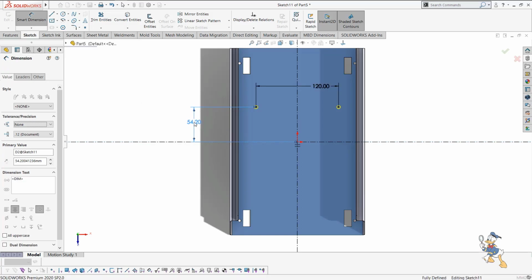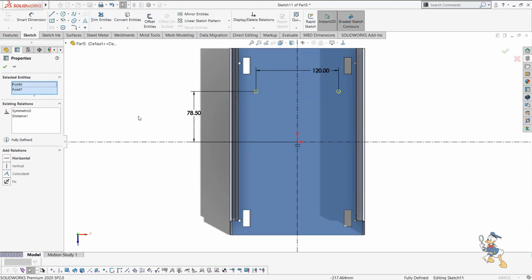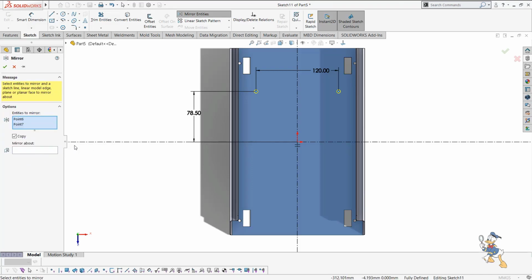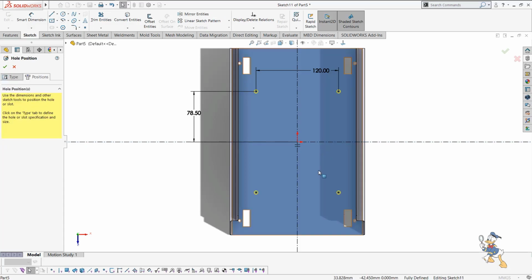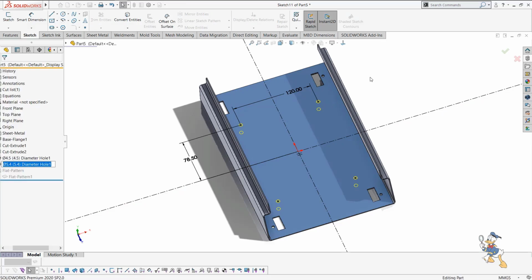We can even give the calculation itself in the dimension of SOLIDWORKS. It is smart enough to calculate and provide the better results without us needing to be involved in the calculation. So these kinds of things reduce our time consumption in design, and we can design our part very fast. So these are very helpful features of SOLIDWORKS, because SOLIDWORKS is very smart. So we have generated some holes at the bottom as well.